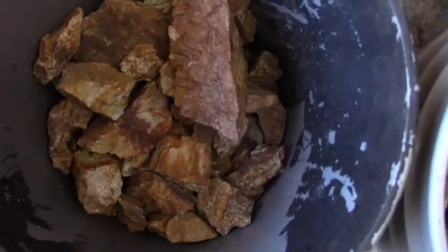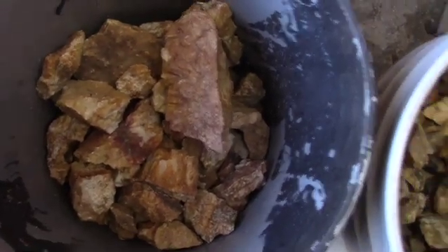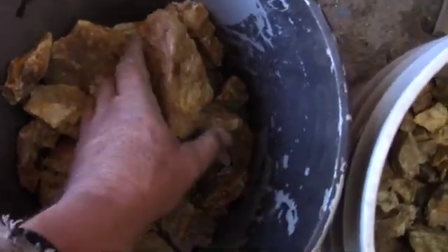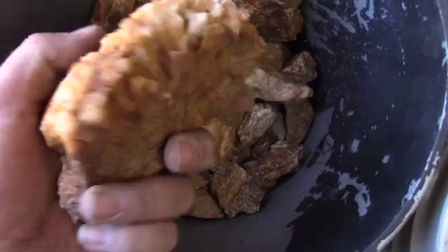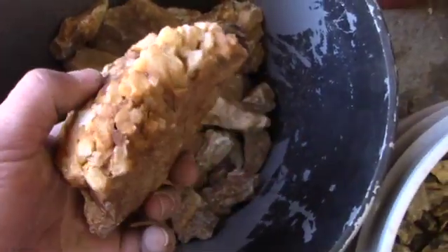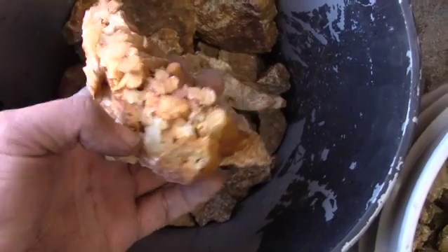Welcome back, everybody. We have three buckets of ore to test today. The first one has some really nice quartz veining in it, or quartz crystals, nice crystalline structure.